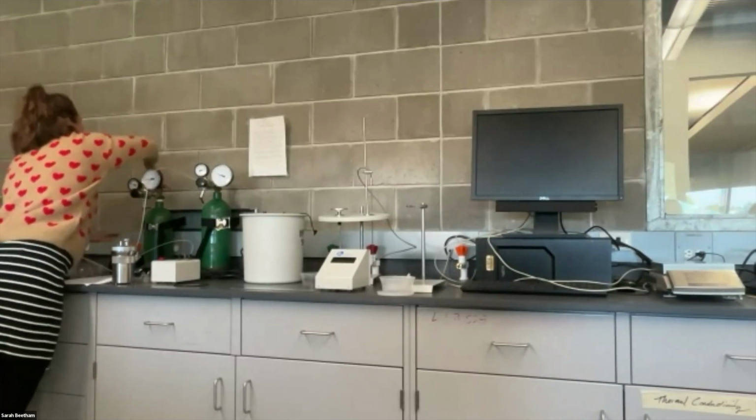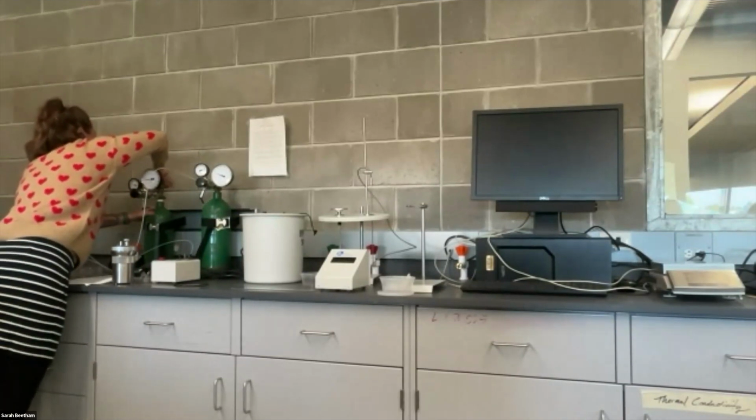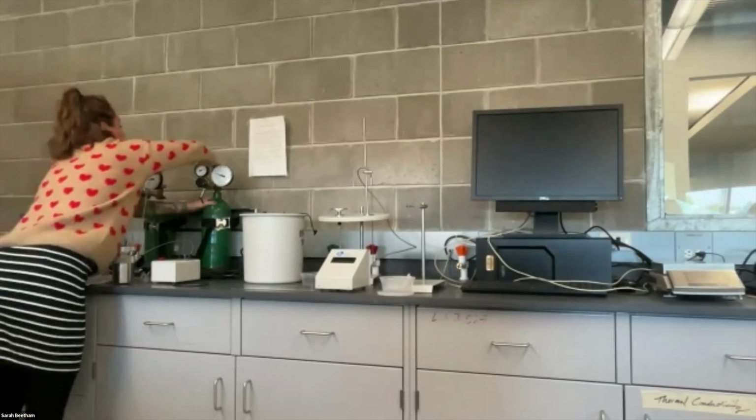Okay, so I'm gonna close up the tank now that I'm done with it. And I'll close this one too.